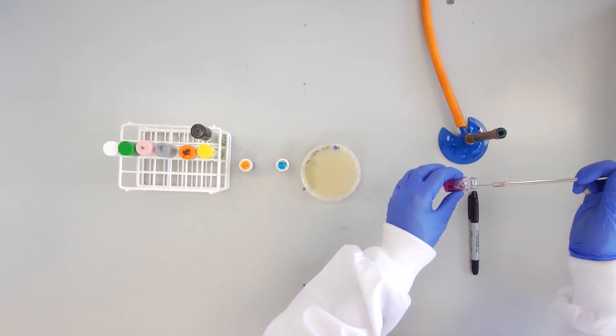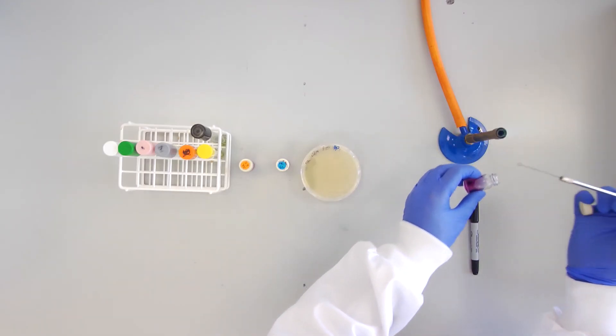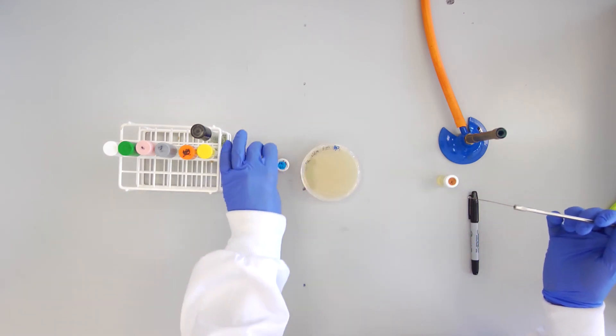All plates, tubes, and bijoux will be incubated at 37 degrees Celsius for 24 hours.